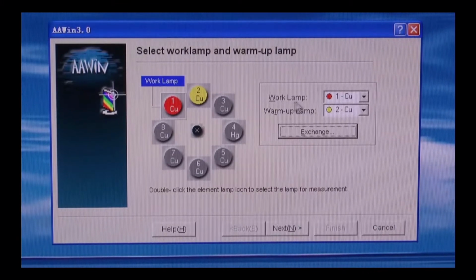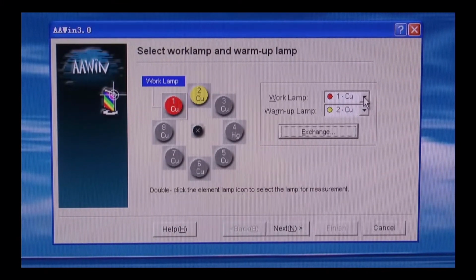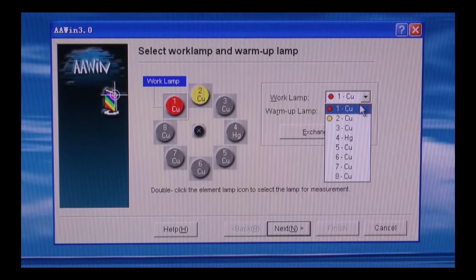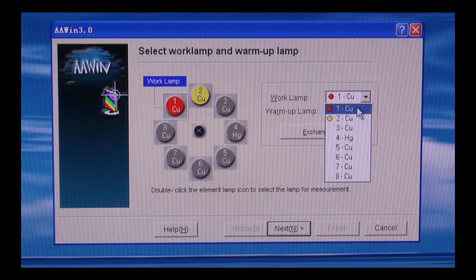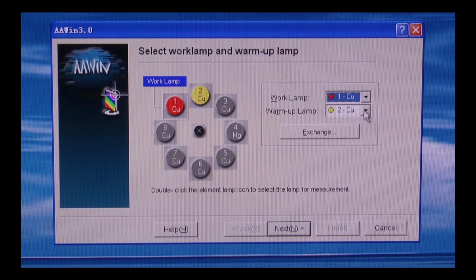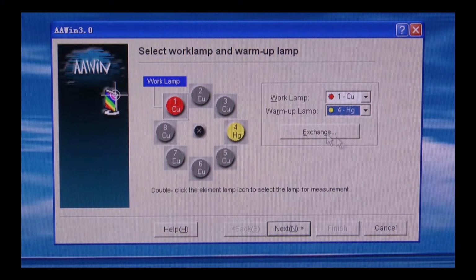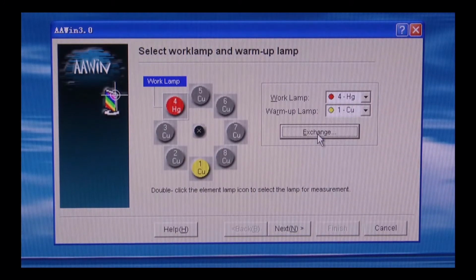For working lamp and warm-up lamp, you can choose according to your application purpose. For example, we take a number 1 copper lamp as a working lamp. Then we choose number 1 position. We choose mercury as a warming up lamp. You can exchange the working lamp and warming up lamp position by clicking on Exchange. And now we press Next.